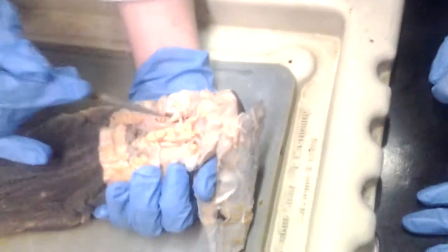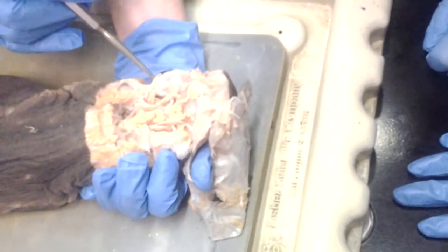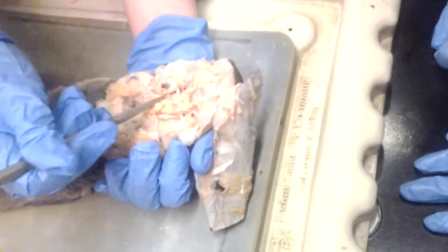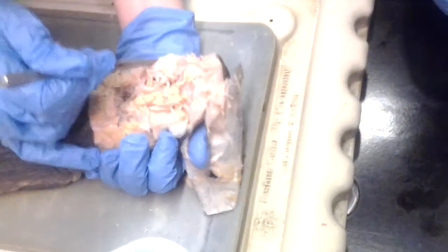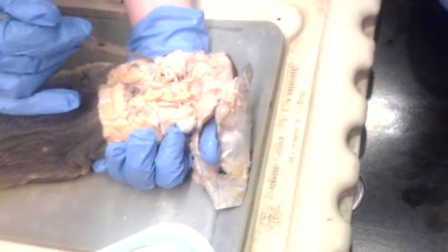Then you have the medial and the lateral rectus. The lateral rectus goes to the back of the eye, and the medial rectus is probably this middle one. This is the medial rectus. Okay. Lateral though. Yeah, lateral. Superior oblique, superior rectus, medial rectus. Now the lateral rectus is not really exposed on this one. You can look at the other eye.